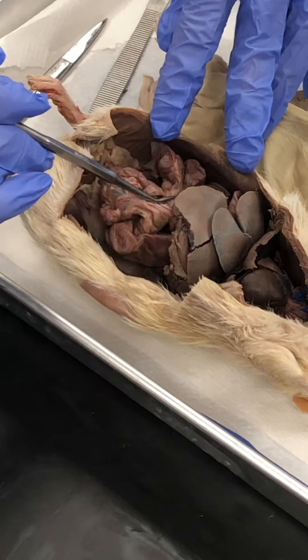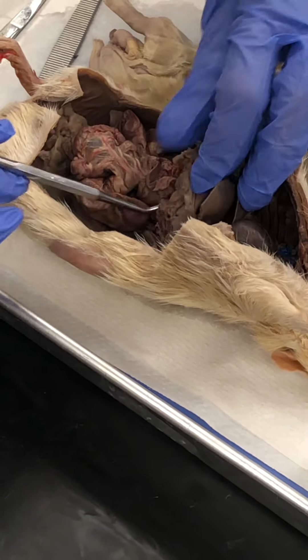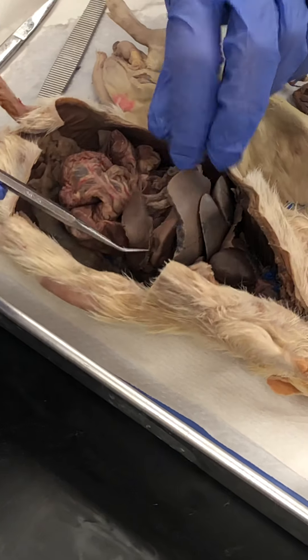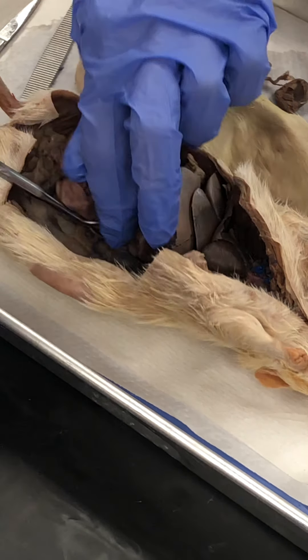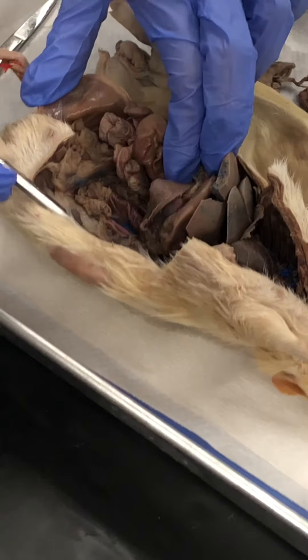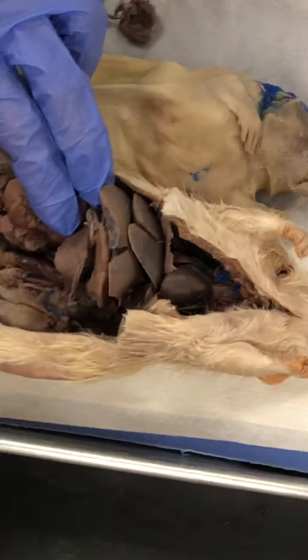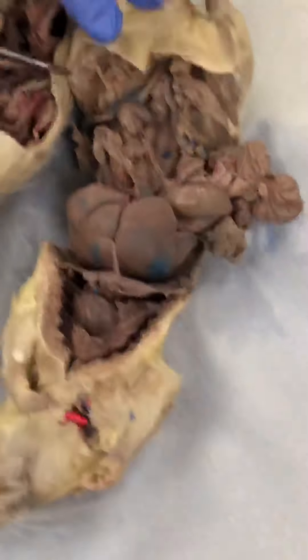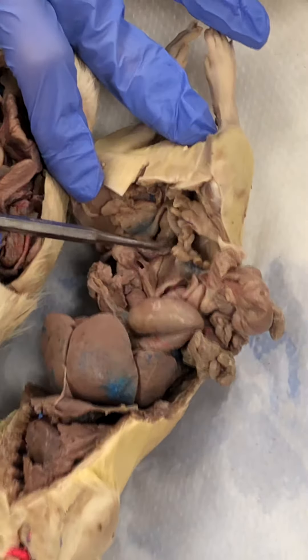We have the intestines and we have the liver. We've got the pancreas, which is under the spleen — so here's the spleen. Then there's the kidney, and we also have the reproductive organs there, like the uterus that you see right here in the female.